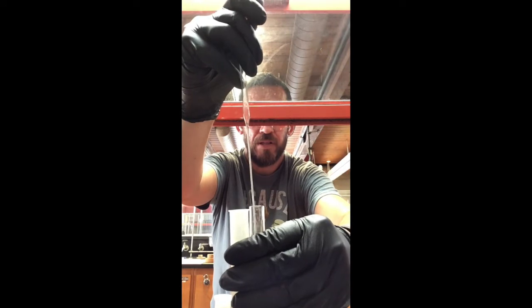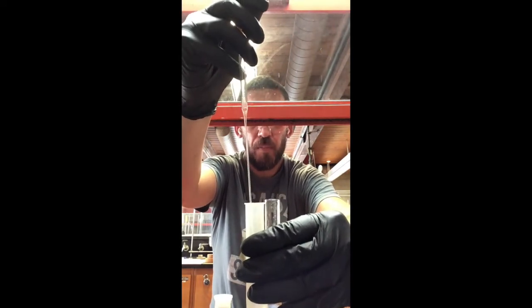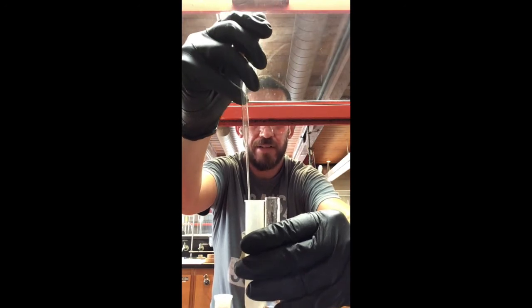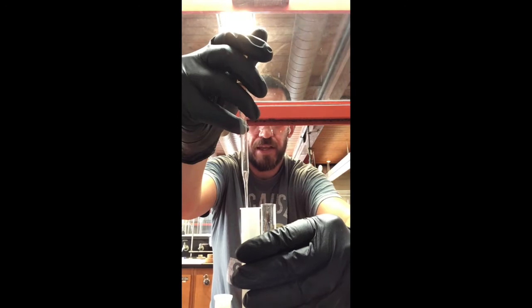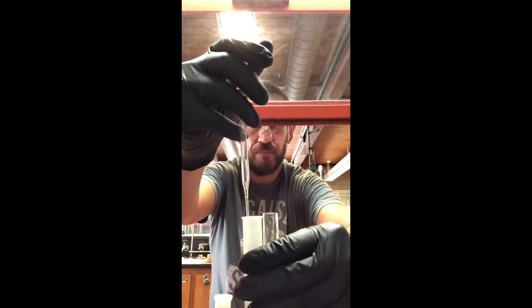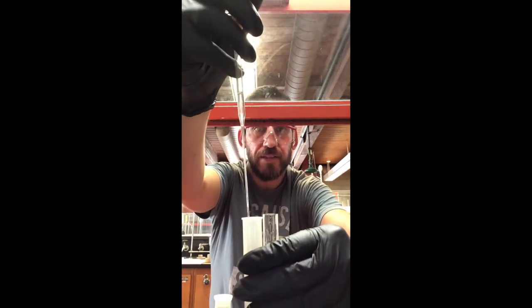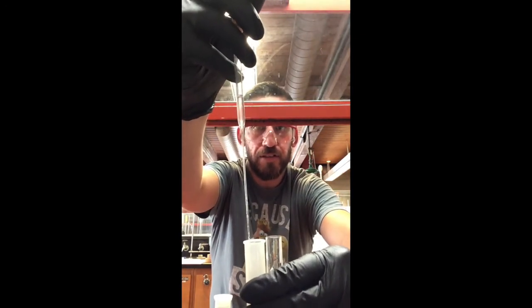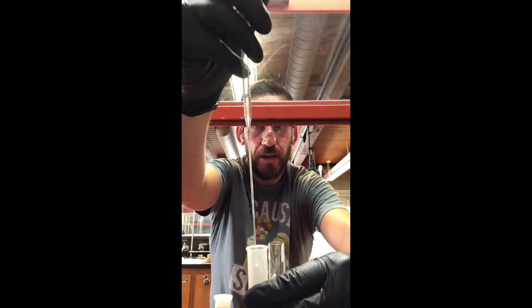Okay. So we do have a little bit more in here. Now this time I'm only squeezing the bulb probably halfway down as I go down. And now I'm only going to get some of that methylene chloride on the bottom. And that's the key to collecting just the rest of the liquid that's in there. You can see there's 2 layers in there now in the pipette maybe. And so what I'm going to do, you see that?